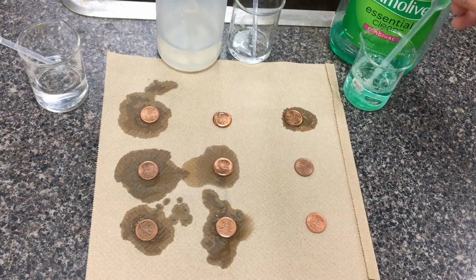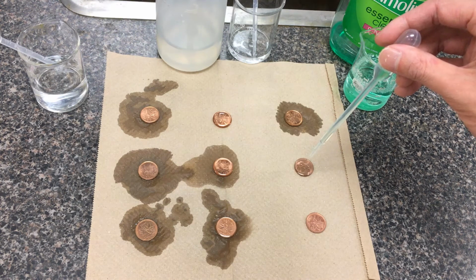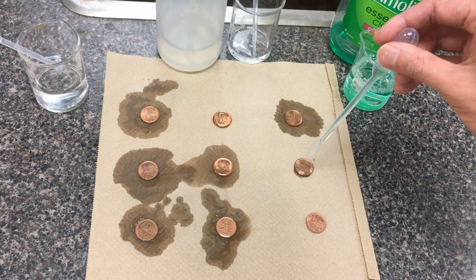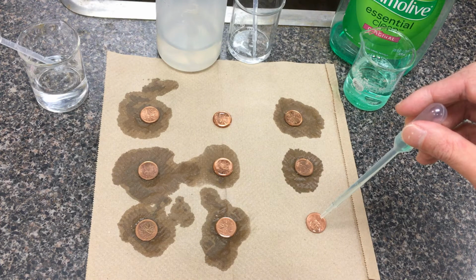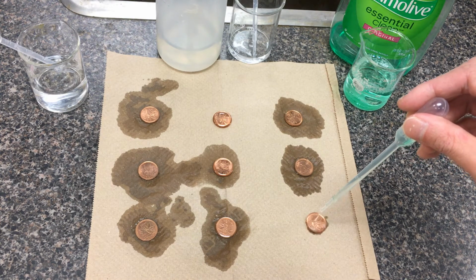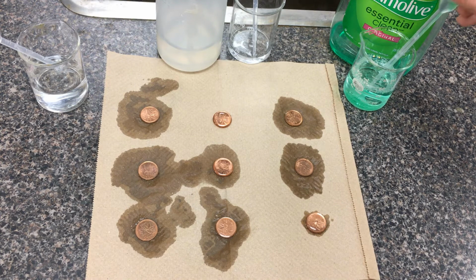Okay, reload the solution here. 1, 2, 3, ... 15, 16, 17, maybe it's about 17 there. Okay, one more solution here. 1, 2, 3, ... 13, maybe about 13, 14, 15, 16 maybe, right?